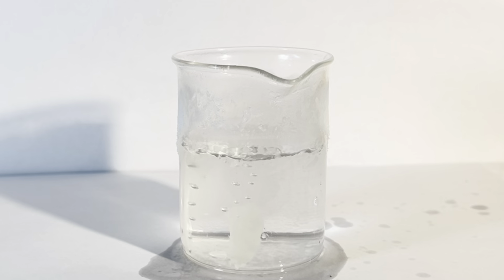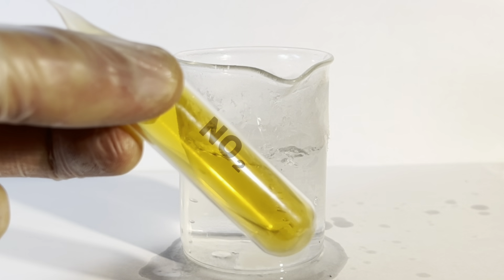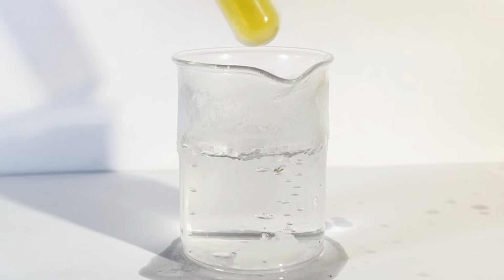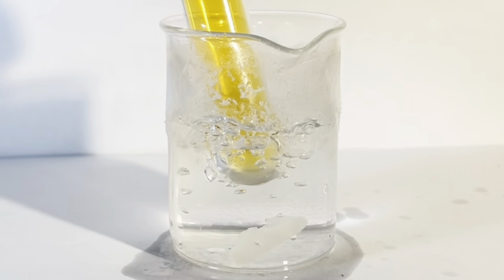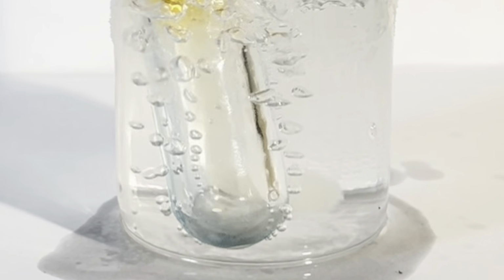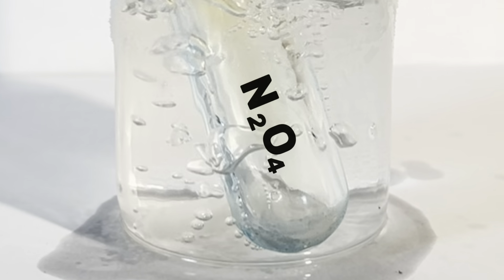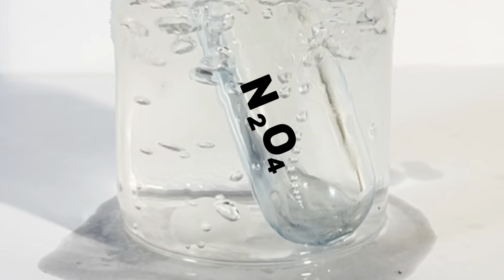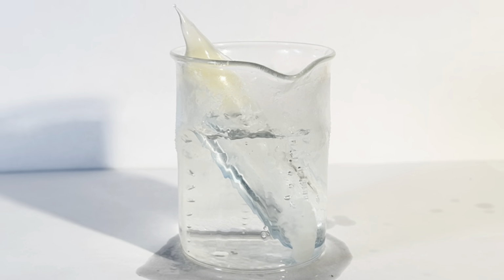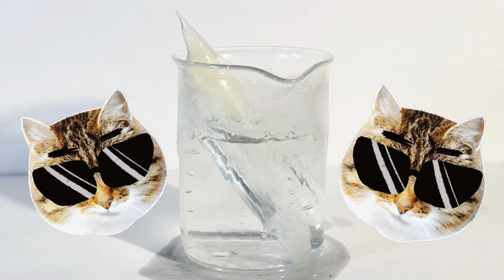So I have here a beaker full of liquid propane at negative 42 degrees C, and then an ampule of nitrogen dioxide gas at room temperature. You can see that when I cool the nitrogen dioxide in the propane bath, it goes from deep orange to clear, as it first dimerizes to dinitrogen tetroxide, which is most favorable at this temperature, and then supposedly freezes solid. I think that's pretty cool.